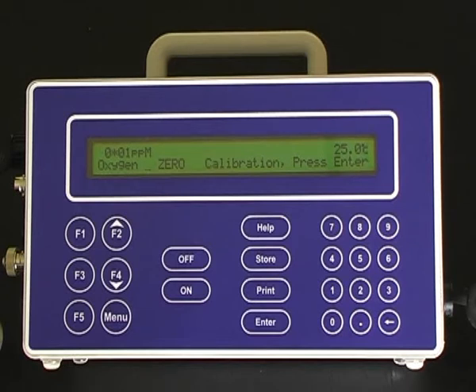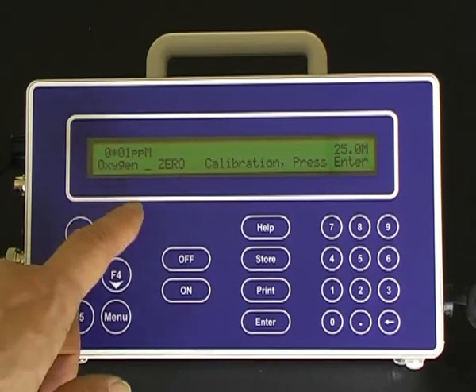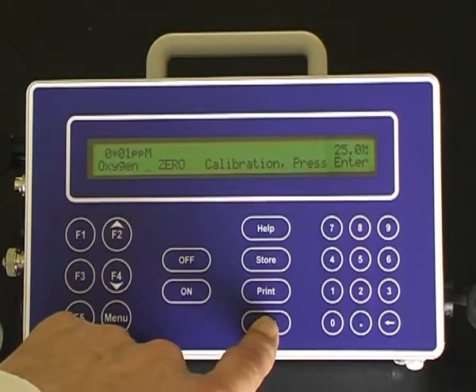Once the dissolved oxygen sensor has equilibrated in the zero solution, press the enter button to calibrate the zero point.